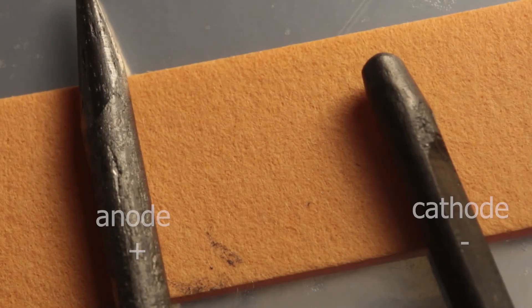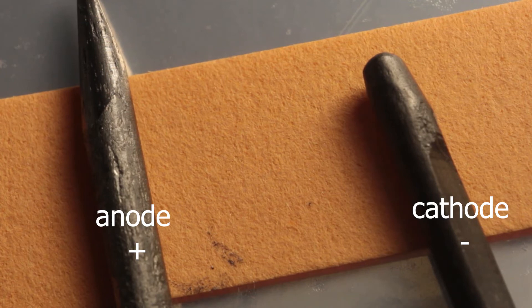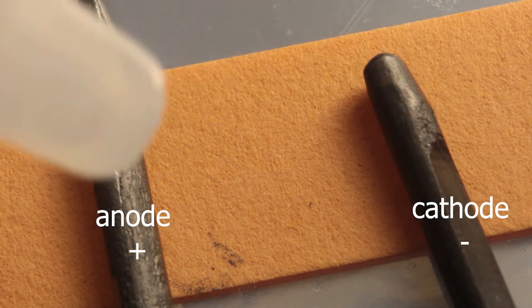Let's do it again, again on micro scale. I'm just putting electrodes straight on pH paper to see the products.